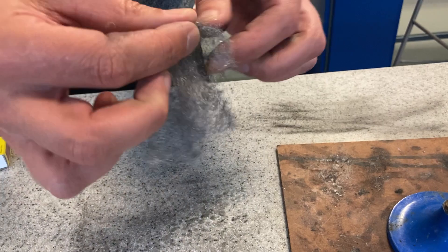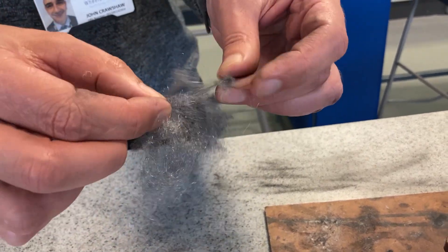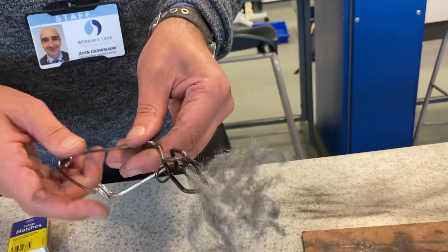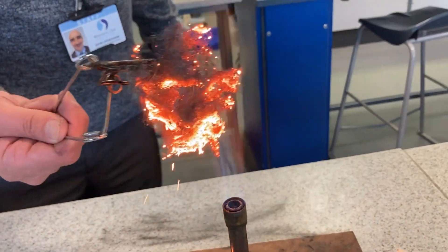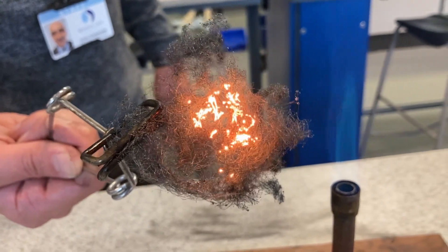And then because it's fluffy, it'll really really go — it should go absolutely fantastic. Fluffy means oxygen means much better, and that's reacting away. Now take it out of the flame and it just reacts by itself. It's still reacting away, still burning away, and that burns much much better because of all the oxygen.